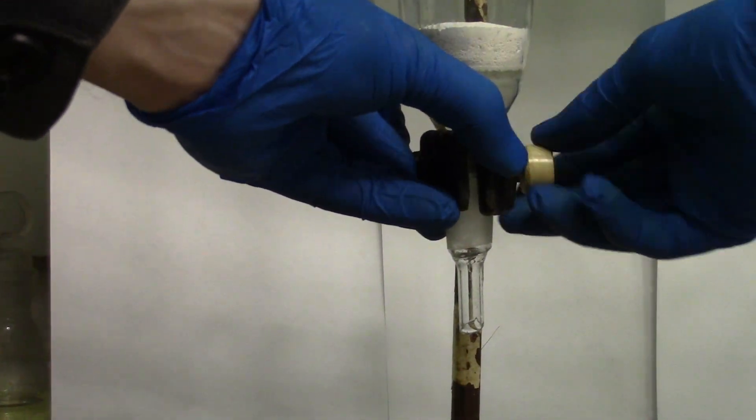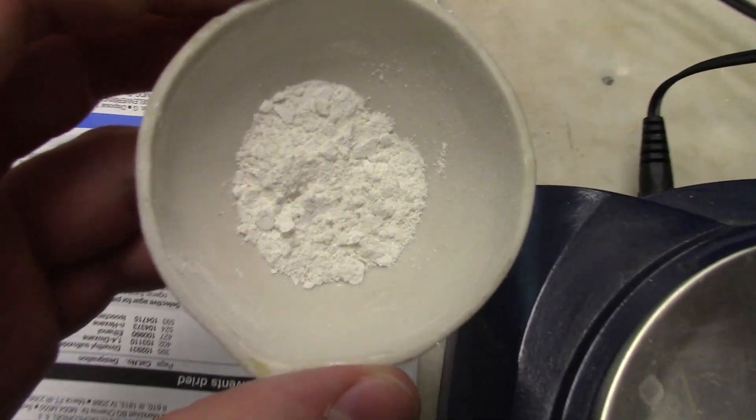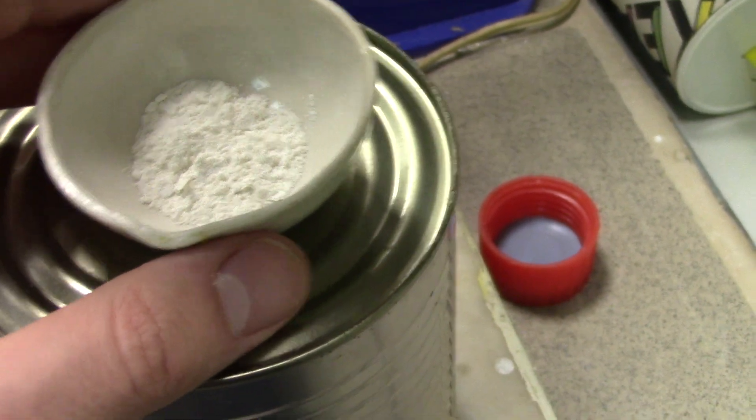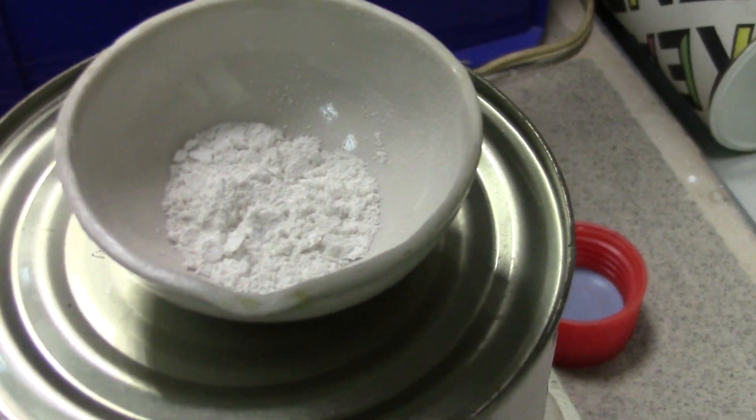After, just put your silver chloride to drain onto an air flow for 2 hours. We have successfully made 20.71 grams of pretty pure silver salt, and it's about 97% yield, considering the fact of other metal presence in the initial material.